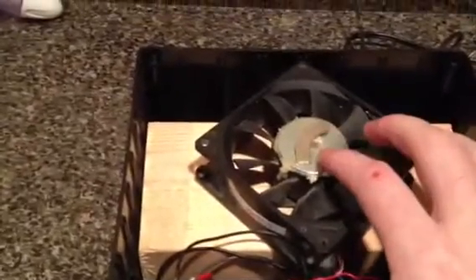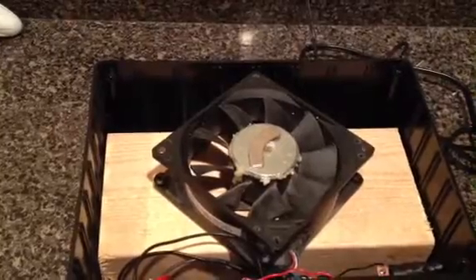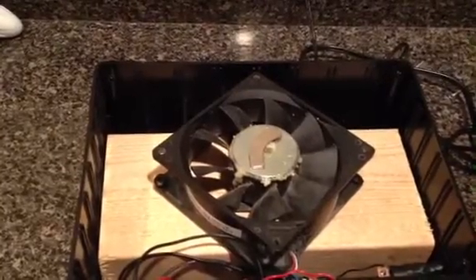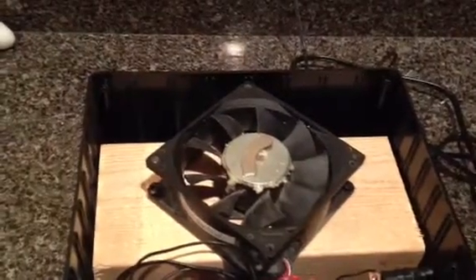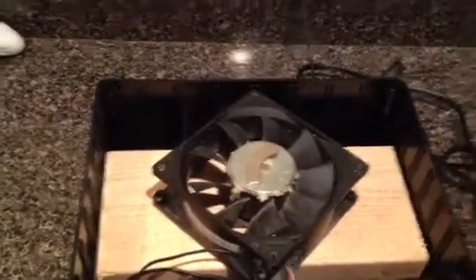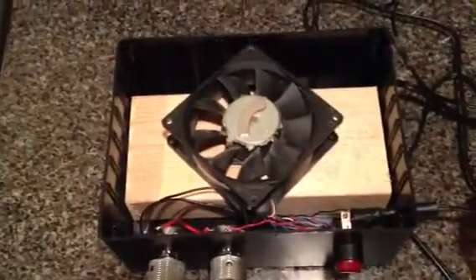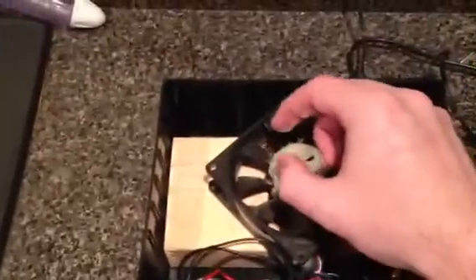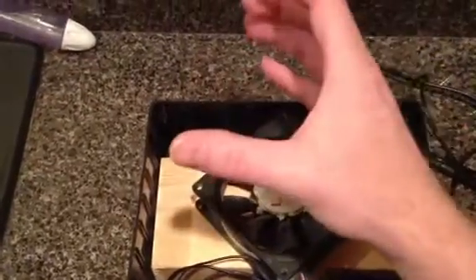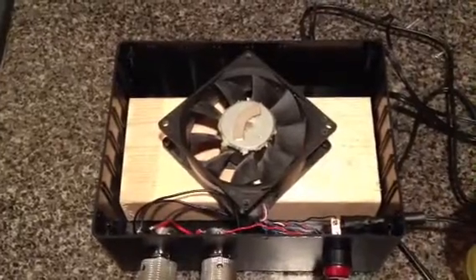What I did is I took a metal washer, put it on the grinder, and ground it down on the back side just to rough it up. I took a piece of 60 grit sandpaper to the plastic itself and put some deep gouges in it. I used Gorilla Glue just because that's what I had convenient and in house. It seems to hold up perfectly fine — I put a beer bottle cap on there and set a bottle of water on it just to give it some holding force for a couple hours until it set up.